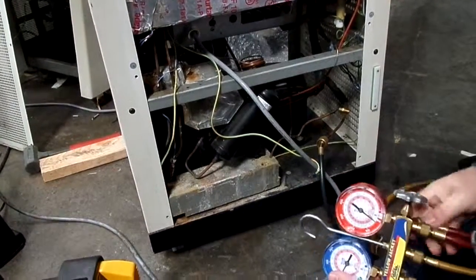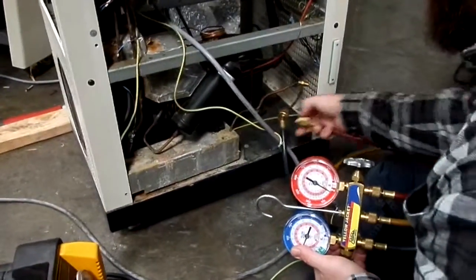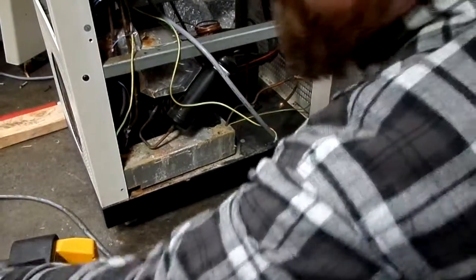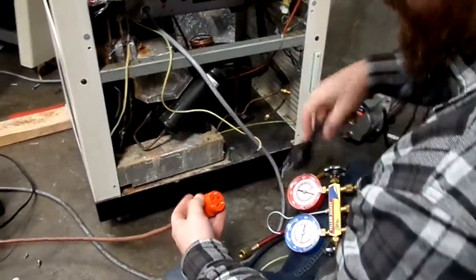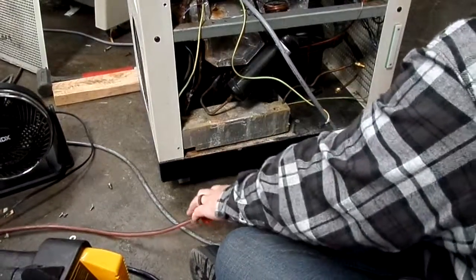Make sure your gauges are closed when you're hooking up your hoses. In fact, I didn't even want to do that yet. So first things first, we're going to use that vacuum pump to evac our hoses. Make sure that we have a vacuum inside of our hoses, because we don't want any sort of contaminants to reach the recovery tank.